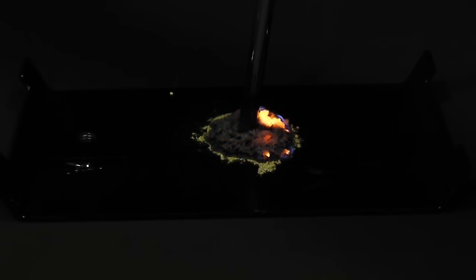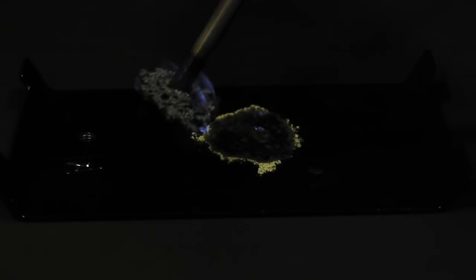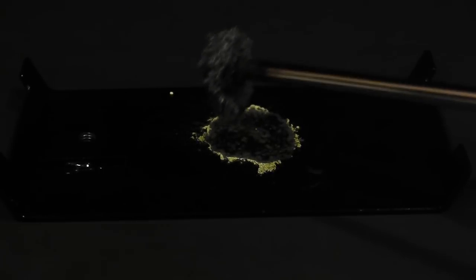When iron and sulfur react, they form one of the simplest compounds, iron sulfide. Of course, it's not really that simple. This is actually known as a non-stoichiometric reaction. When the sulfur and iron particles are hit with a catalyst, they form this amazing substance you see before you. Iron sulfide.